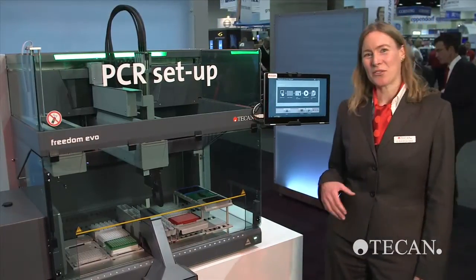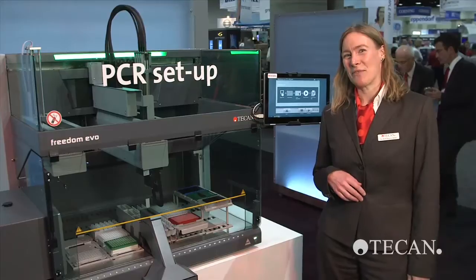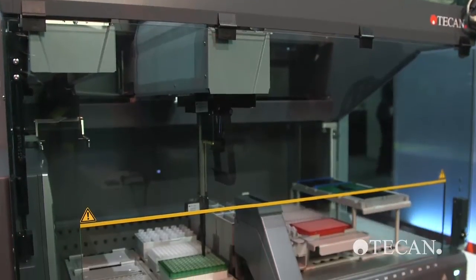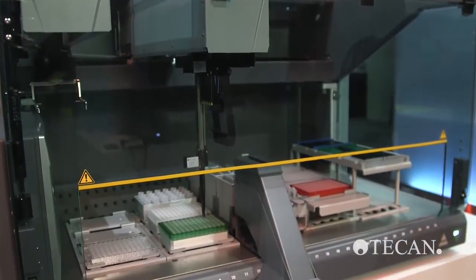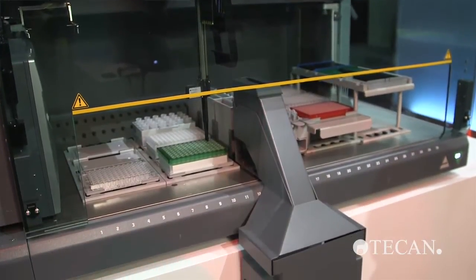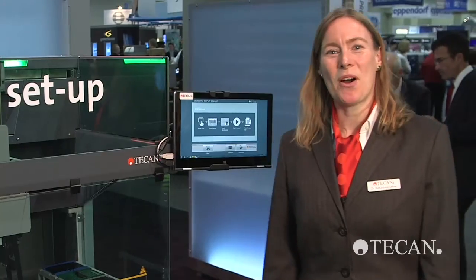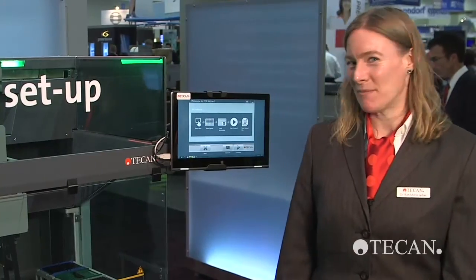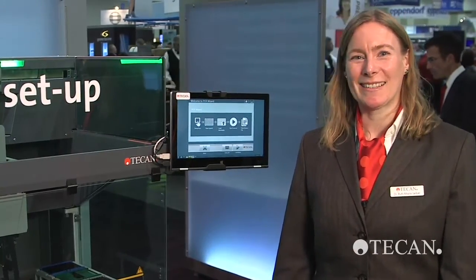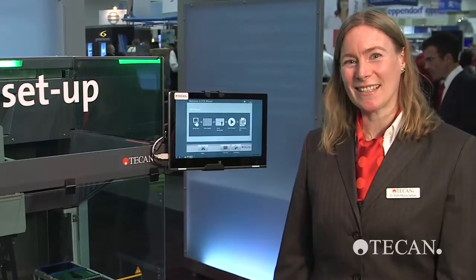It's called the Touch Tools PCR wizard. The wizard will help customers automating their genomic workflows in reaction setup for endpoint, real-time and multiplex PCR, as well as expression analysis, genotyping and sequencing or even pathogen detection.